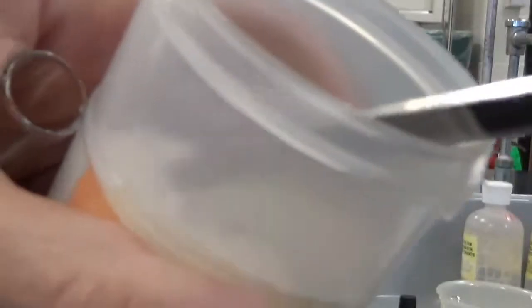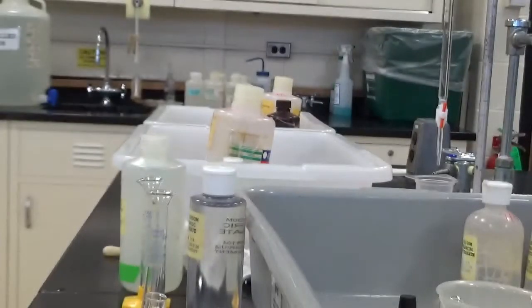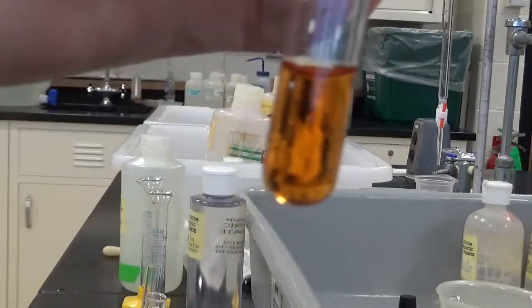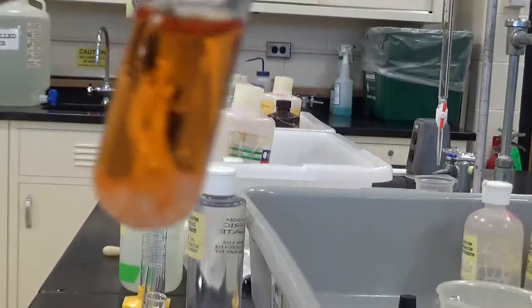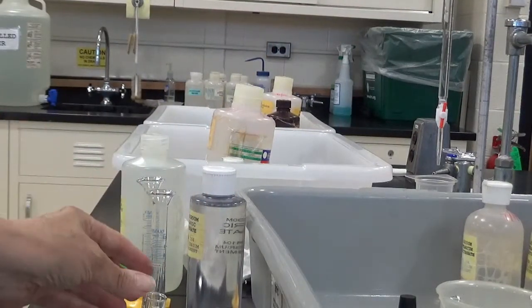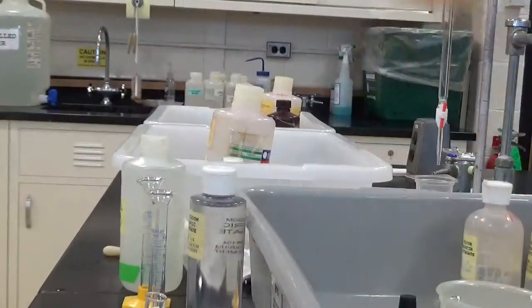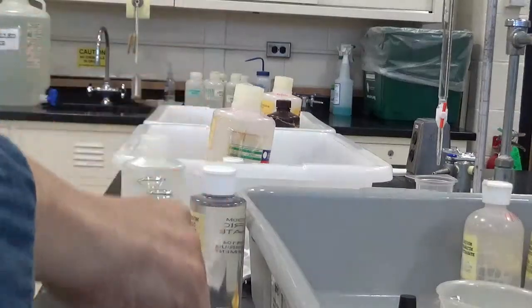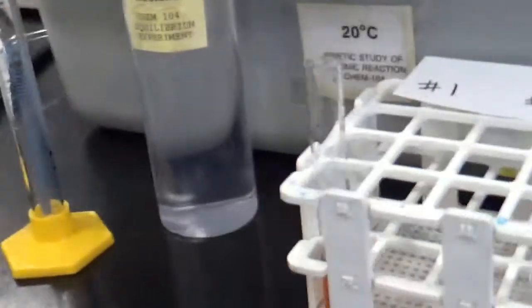Get the potassium nitrate. Oops. It's very slippery. I'll get a bunch. Here's my test tube. Potassium nitrate. Really, nothing happens. Okay. If you compare that to the distilled water one, it's basically the same. If anything, it might have gotten a little lighter. It's kind of weird. All right, so I have my 4 test tubes.